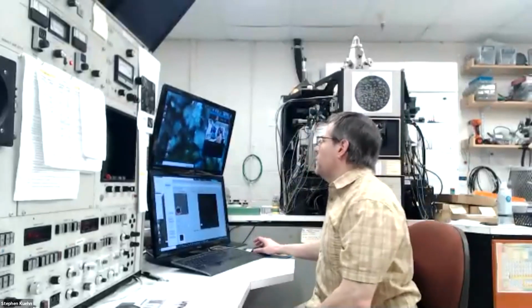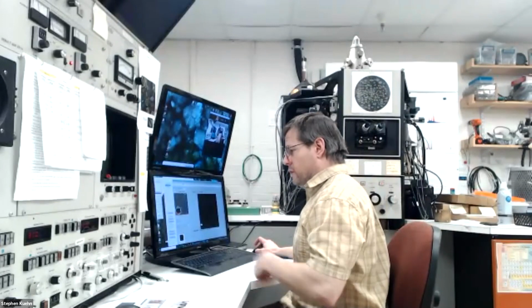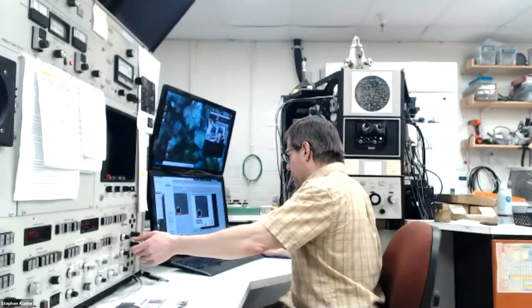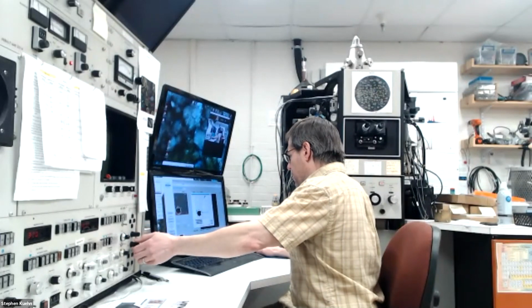Something like that. All right. So I'll have to readjust the brightness, but I was noticing it was kind of giving me this little ripple interference pattern on that image I just tried doing. So we don't want that. Let's turn up the contrast a little bit more. I want things to pop out a little bit more.